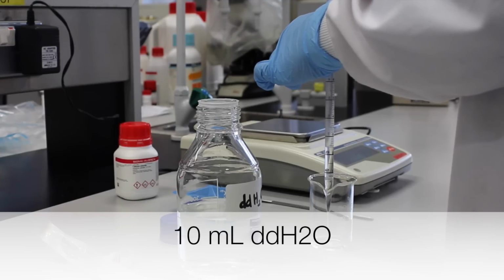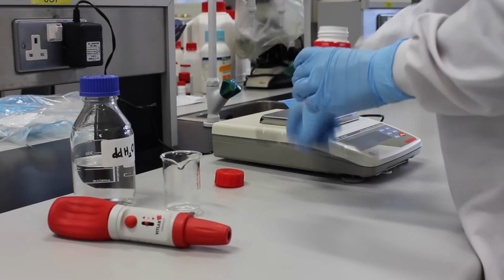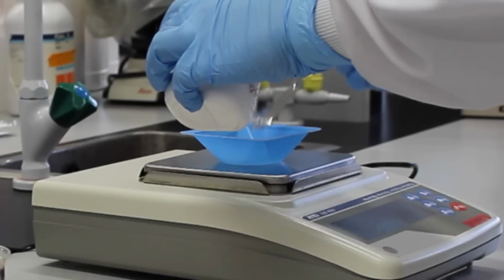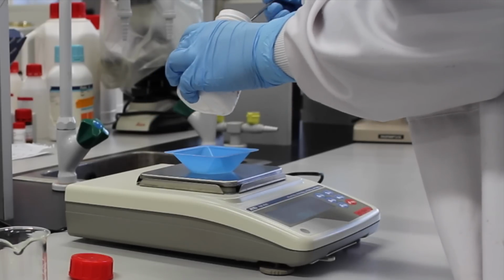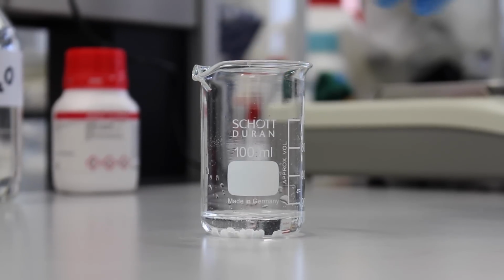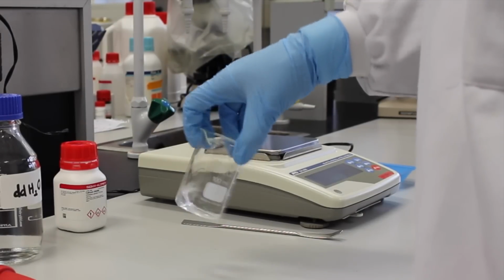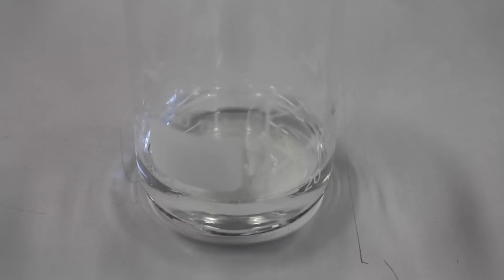10 milliliters of water is added to a beaker. To make 10 milliliters of 1 molar calcium chloride, 1.11 grams of calcium chloride is weighed out and added to the beaker that contains the water. The beaker is swirled until calcium chloride fully dissolves. Calcium chloride solution has now been made. Make sure to autoclave for 20 minutes before use in the lab.